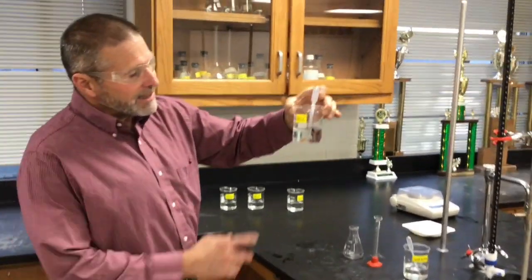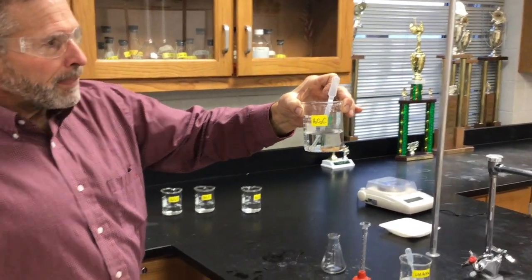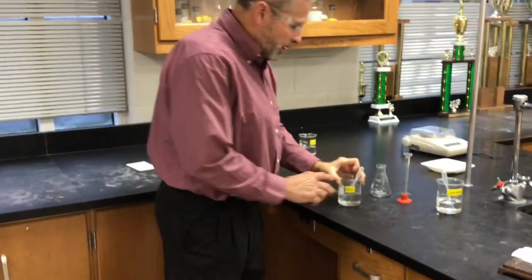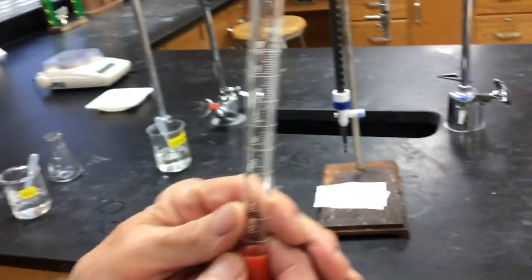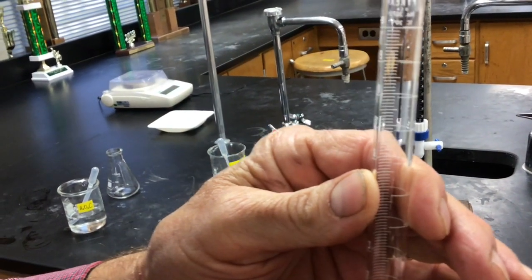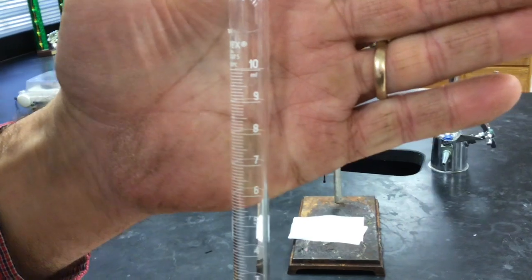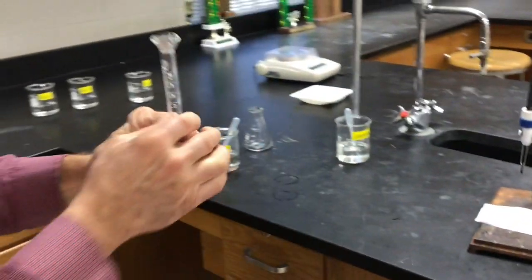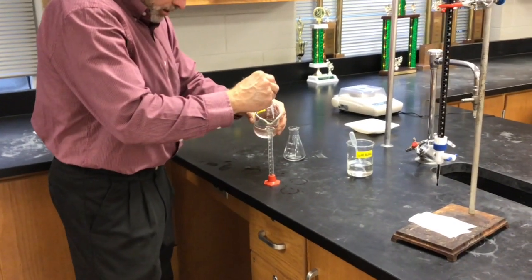So you are looking at sample C here. Okay, and what we'll do is we'll measure out 10 milliliters. Now I show you the cylinder that we're using. How's that graduated? So the cylinder is graduated to the 10th place. And you're measuring out 10.00 milliliters? I am trying to do my best here.